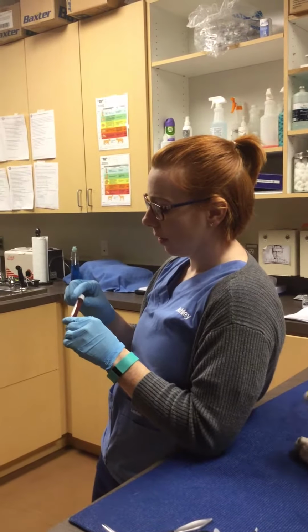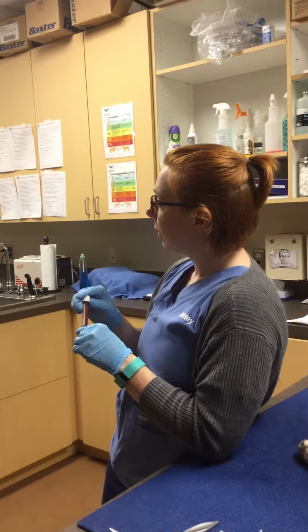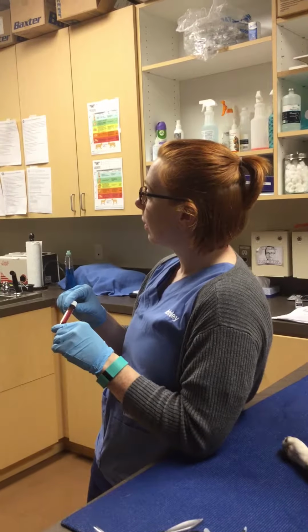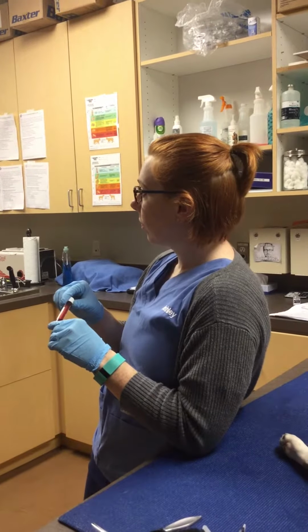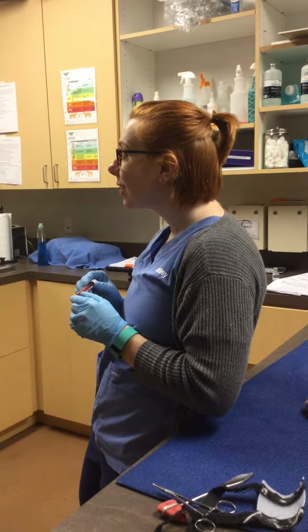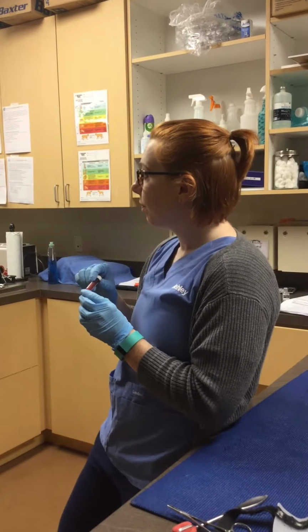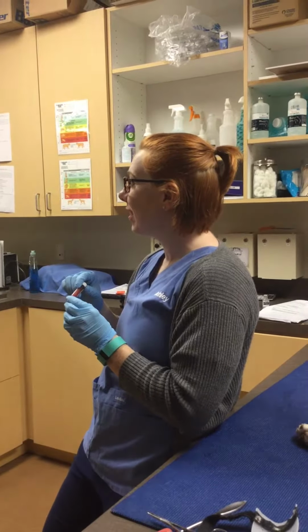Minutes. 2 minutes, 10 seconds. So I'm checking it every 10 seconds. 2 minutes and 45 seconds.